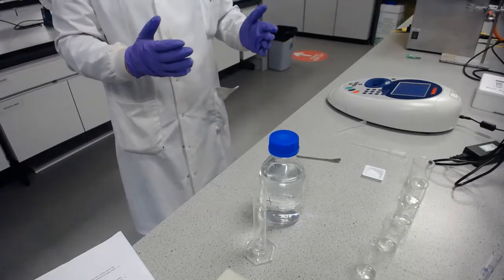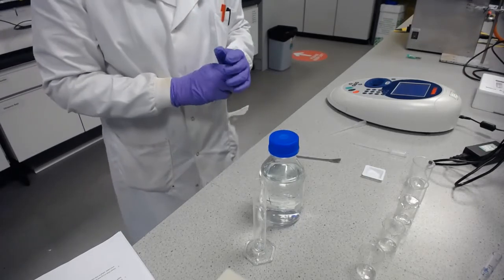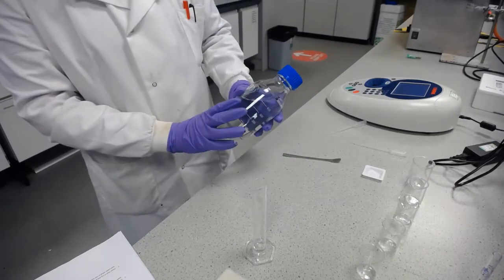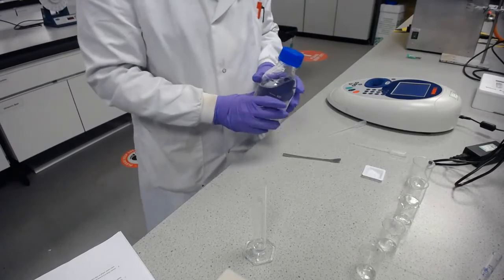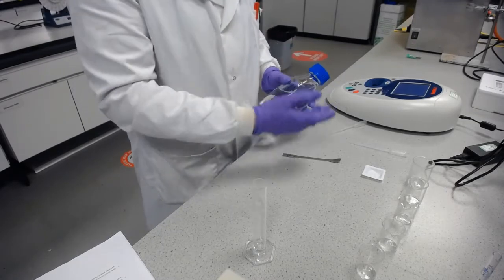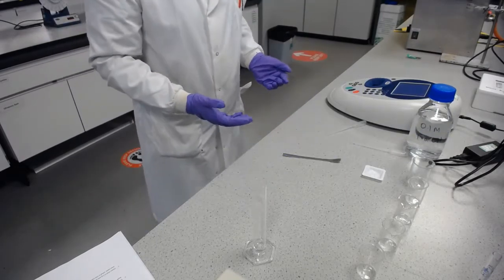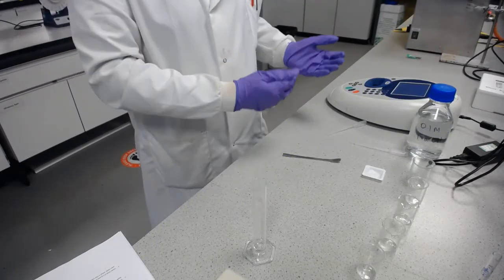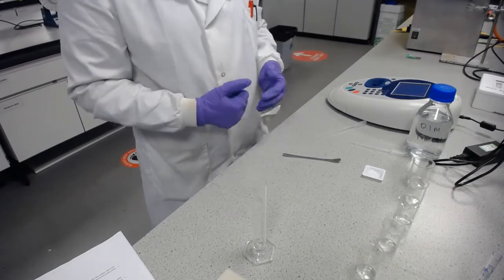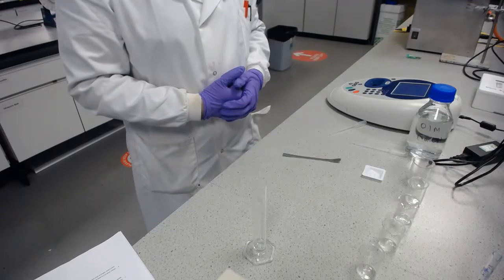Whilst the DCM and water are separating and the trimethoprim is coming to equilibrium across the two phases, we're going to set up and determine a calibration curve for trimethoprim in 0.1 molar sodium hydroxide, because this is what we're going to be diluting the aqueous phase with later on when we come back to take the UV vis readings. So we're going to use this as a solvent, and we're going to make the calibration curve so that we know what concentration a certain absorbance corresponds to when we do that later. So we can work backwards and determine the concentration of trimethoprim in the aqueous phase, and therefore how much is also in the DCM phase as well.